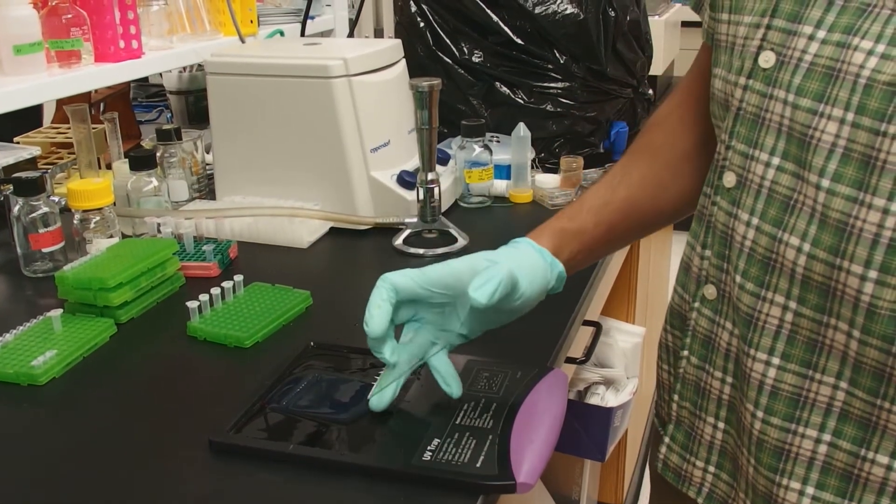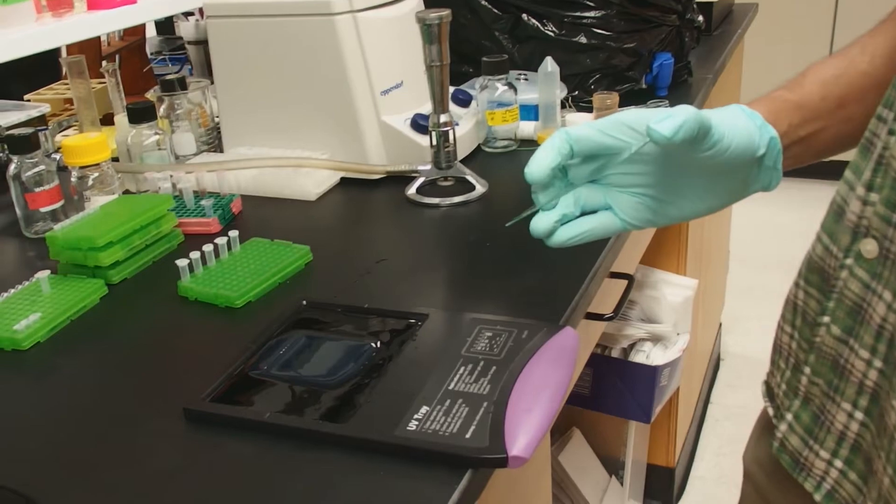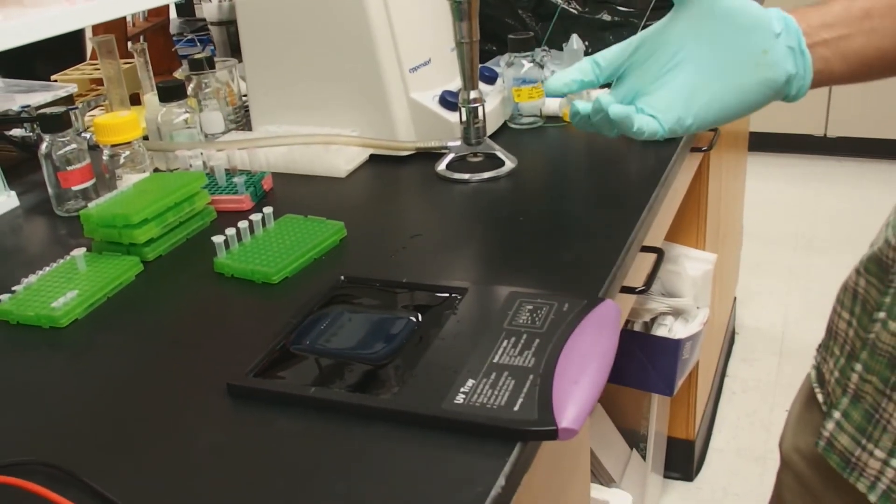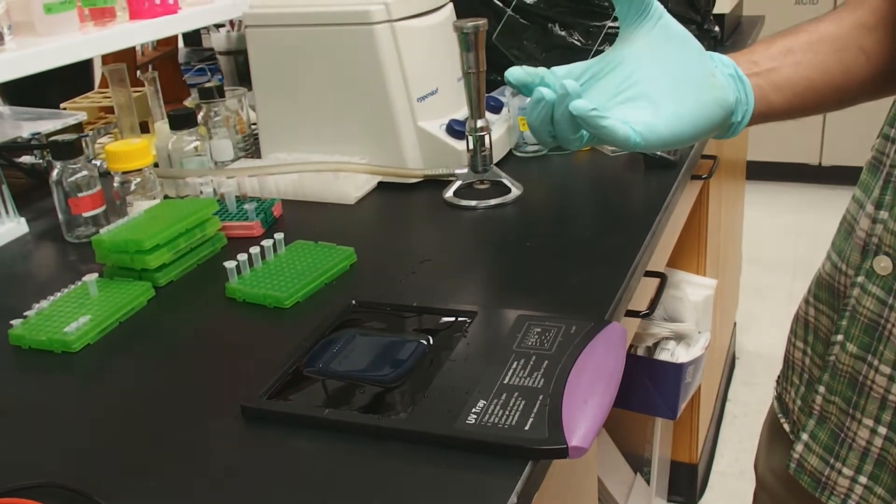In this case, we have this UV tray that will go into the gel imaging system. And that's it. You can image this gel.